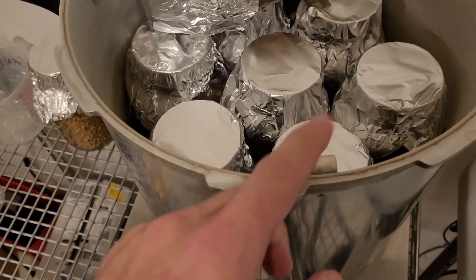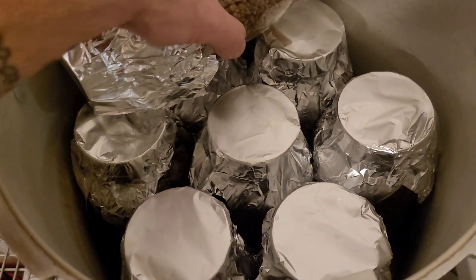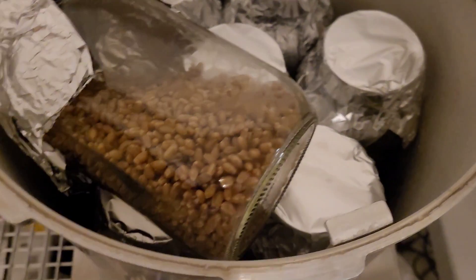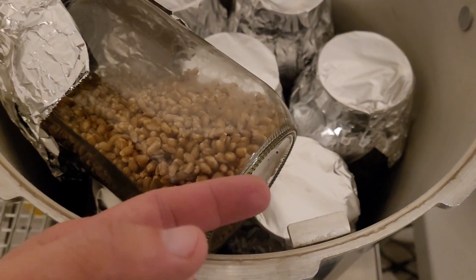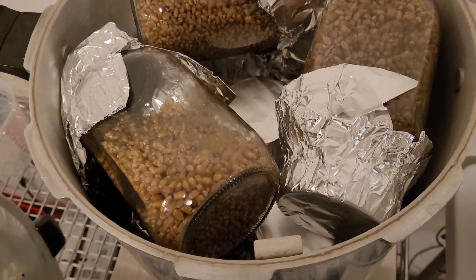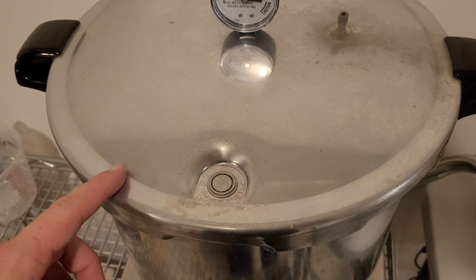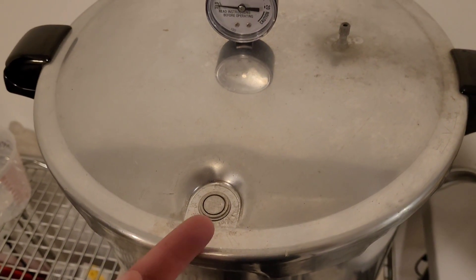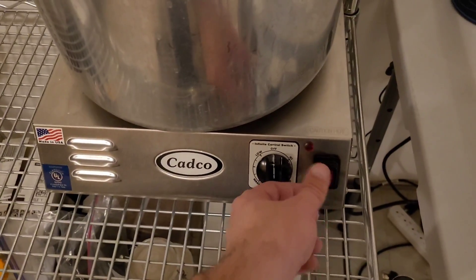Keep in mind that there is a lid lock here, so you want to arrange things so there is ample space so that when your pressure builds, there's free space for your valve to lift up and down without catching on the side of these jars. Leave a space — that's how it's done. Now put your lid on and slide it closed. If it doesn't slide closed, it's a good indication you haven't left enough space and the valve is catching on the lids or on the jars.